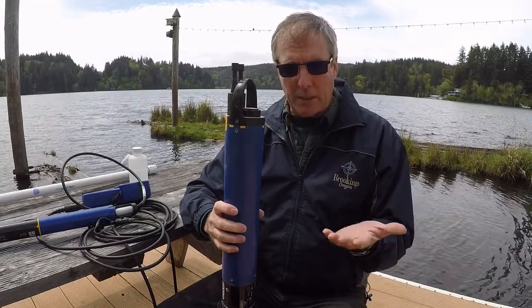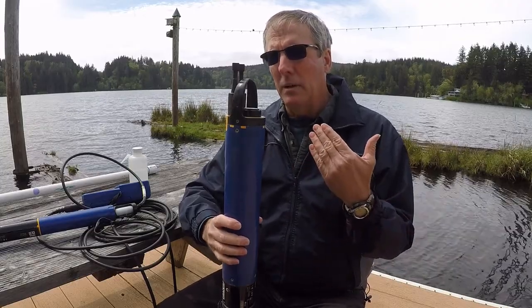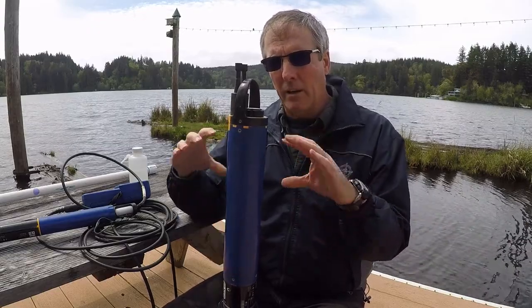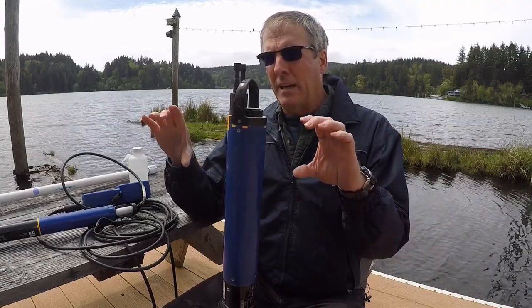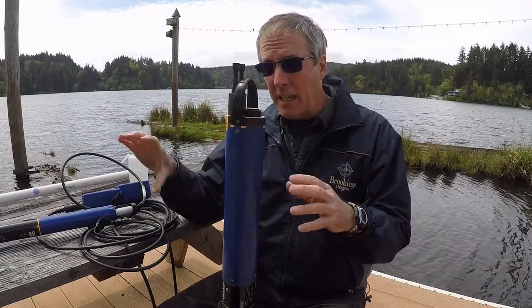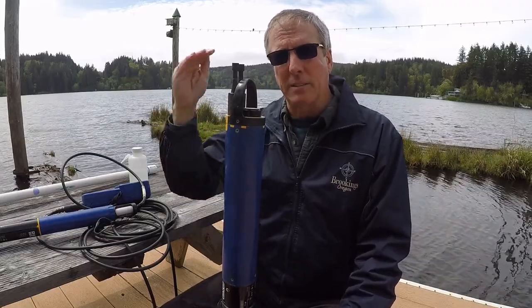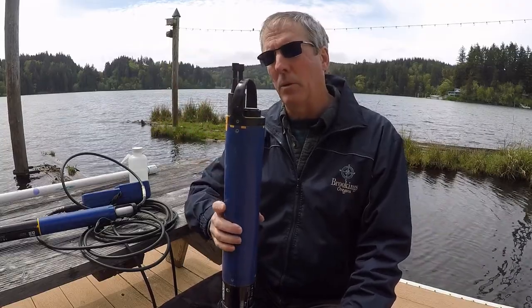You are able to use it just as a static instrument, as I said. If, for instance, you want to find out whether the area underneath a thermocline has zero oxygen and just stays at zero oxygen throughout the whole month, then you can deploy one of these down there and just leave it. Instead of lowering it 1 meter every time, you can just take it out and deploy it.